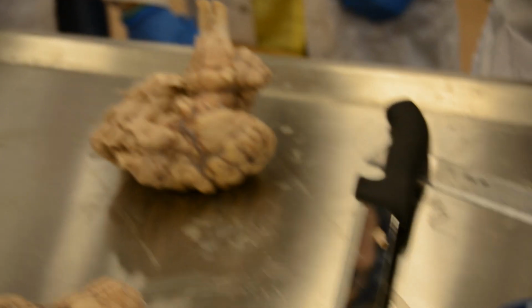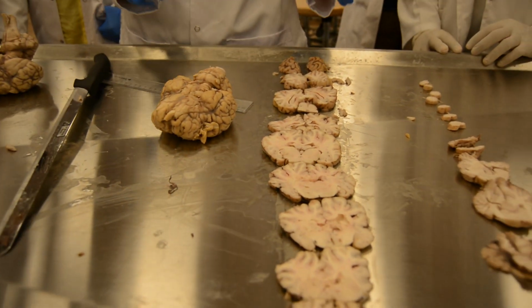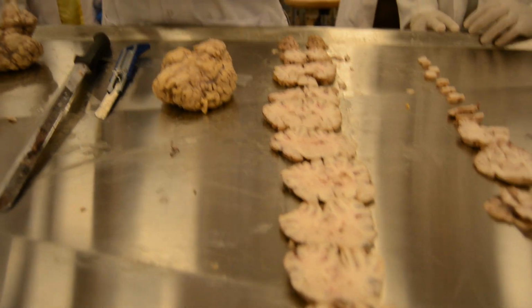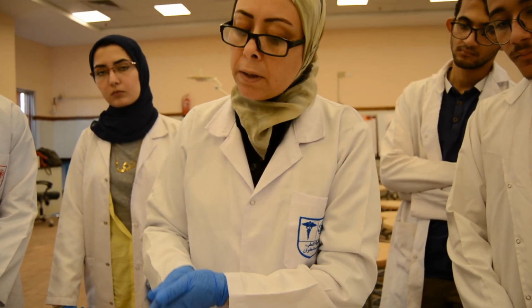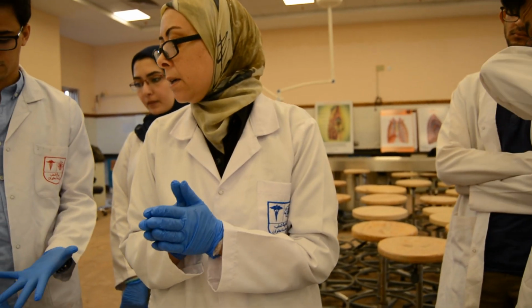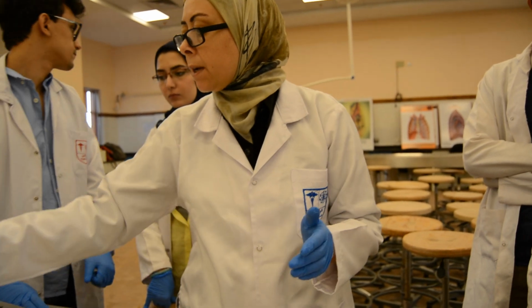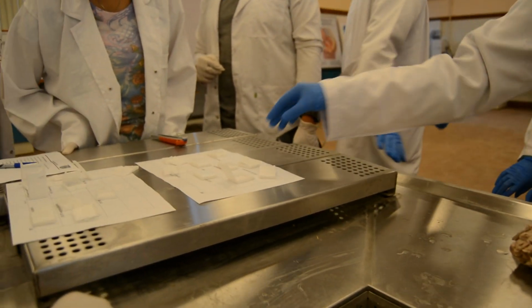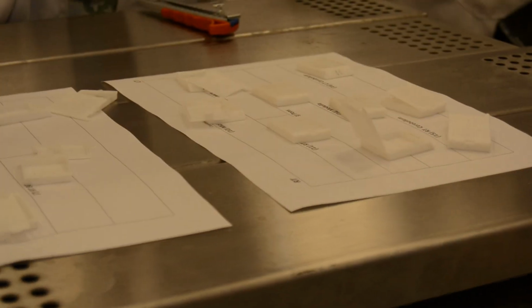Okay. The second step: we will take the samples. We will take the routine samples that a neuropathologist will take to identify a cause of death in a human. A minimum of 12 samples should be taken. Sometimes I take right and left, so they are 16. But at least I shall take 12 samples from these main areas.